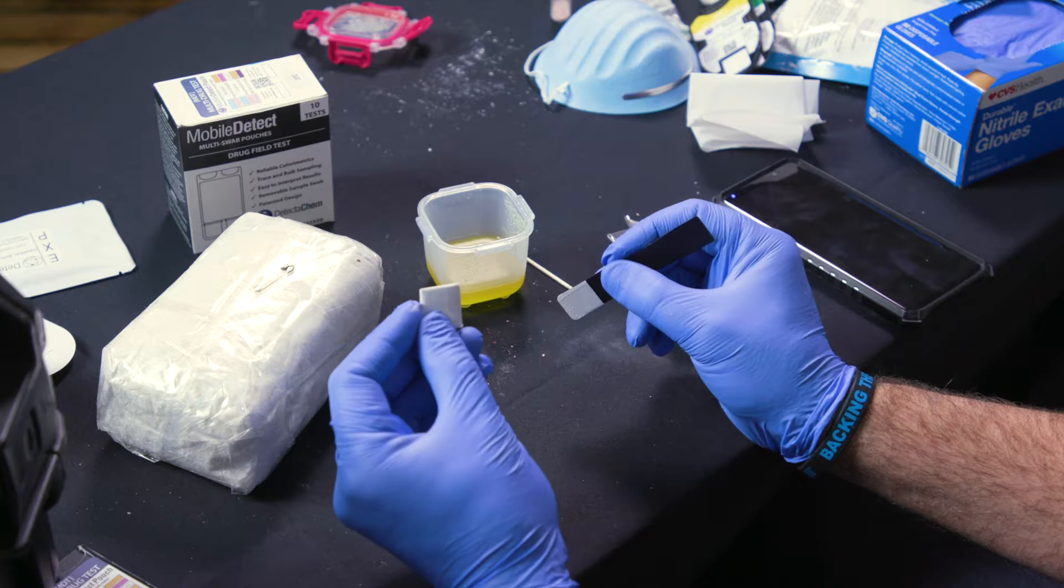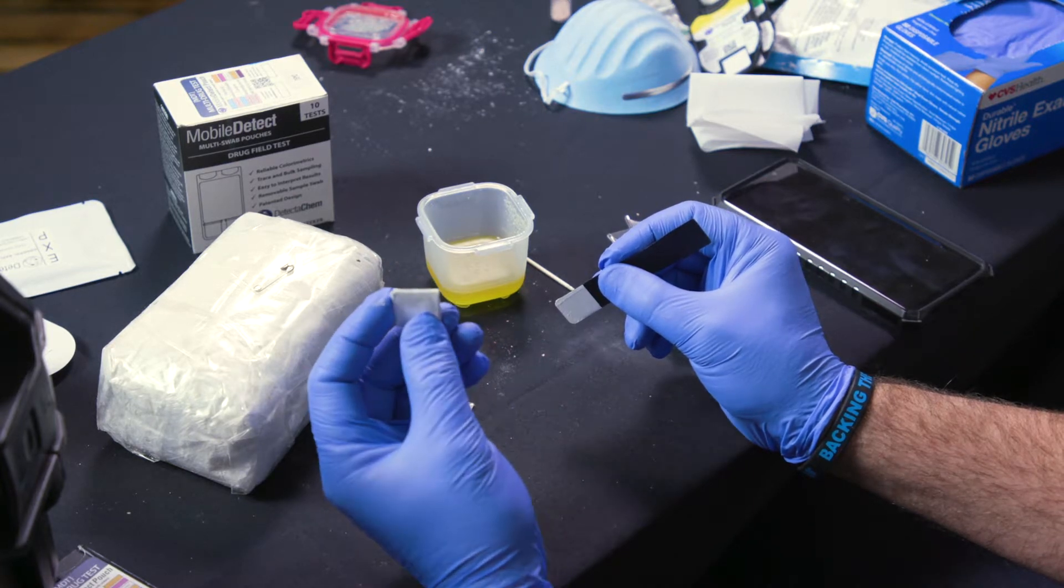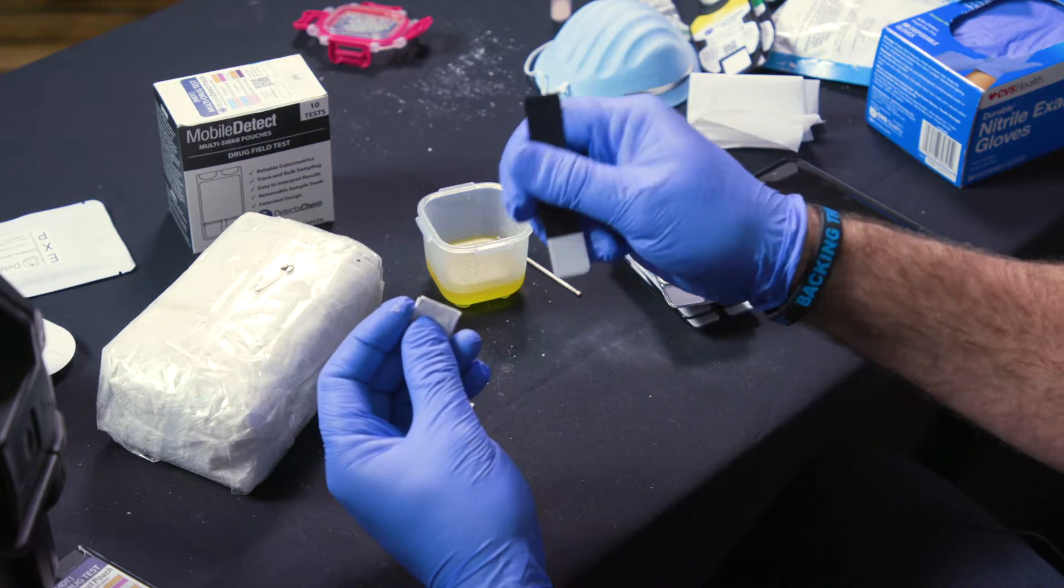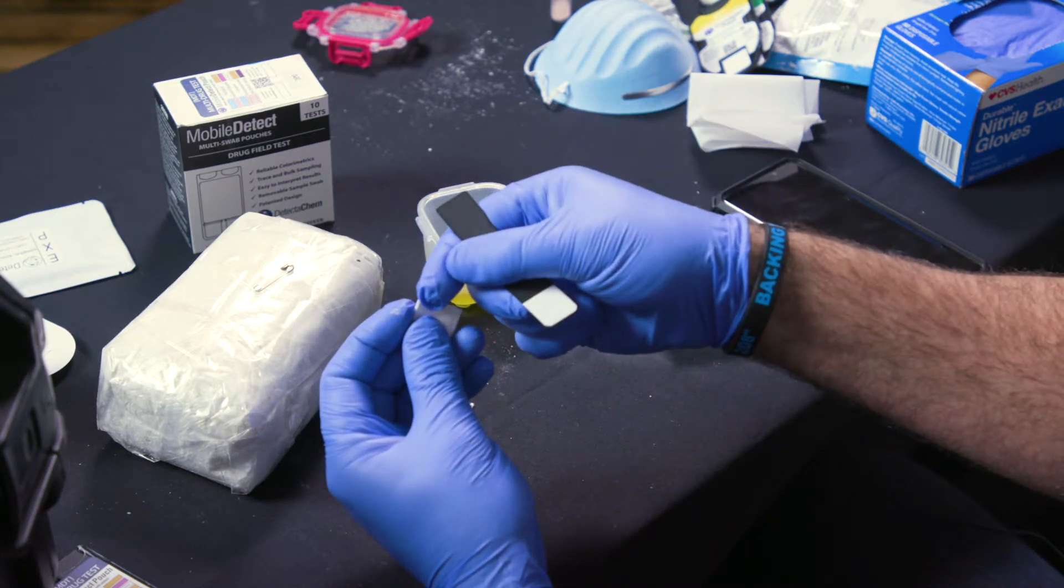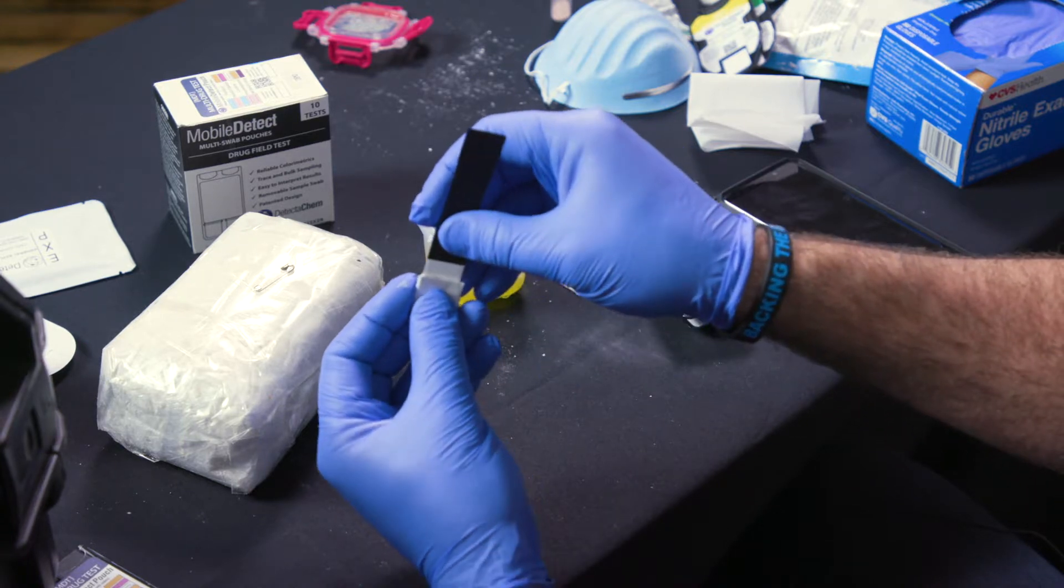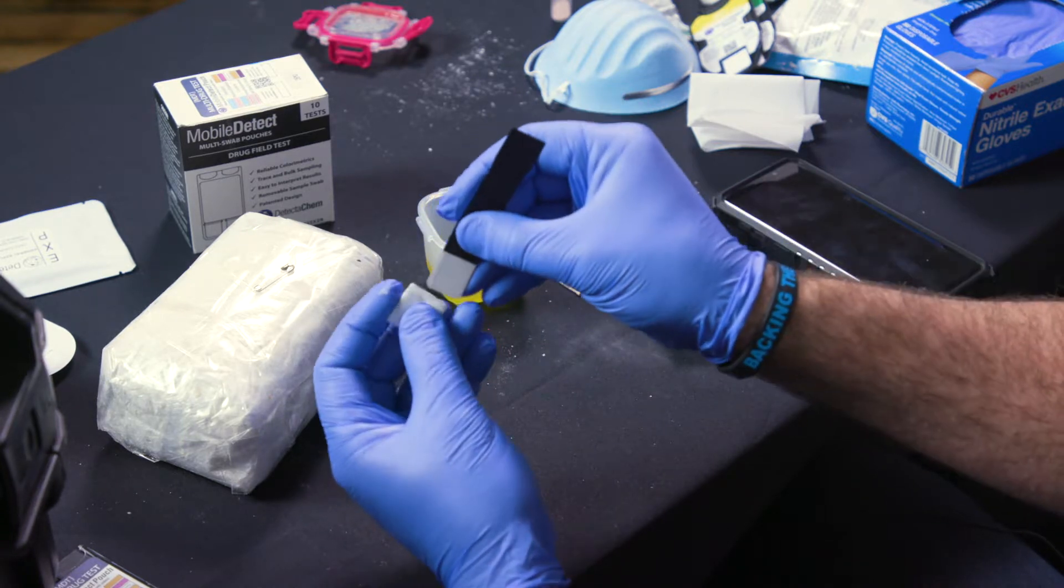The typical wax paper taped up fold-em-ups are also quite easy. What you're gonna want to do, take out your knife, something sharp, just make one cut within the liner there where it's sealed.